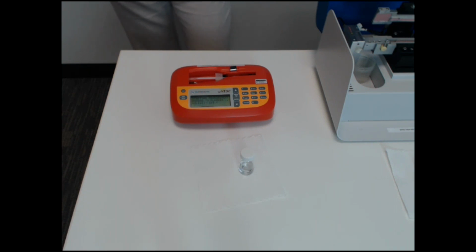So for all the instruments today, we'll be testing isopropyl alcohol. It has a viscosity of roughly 2.2 at the room temperature of our office. So right now it's just moving the pusher block to the end of the pipette. So it is now engaged.